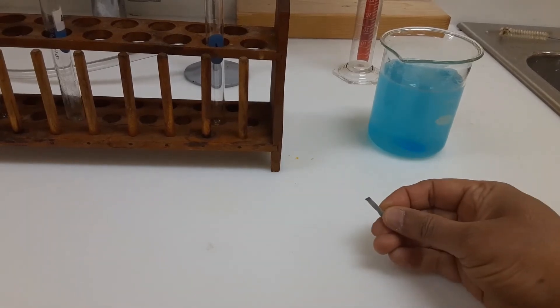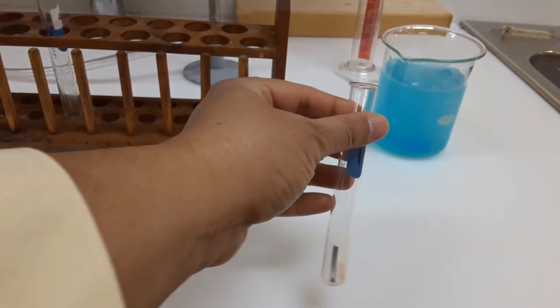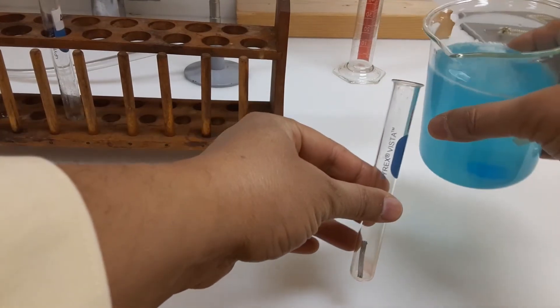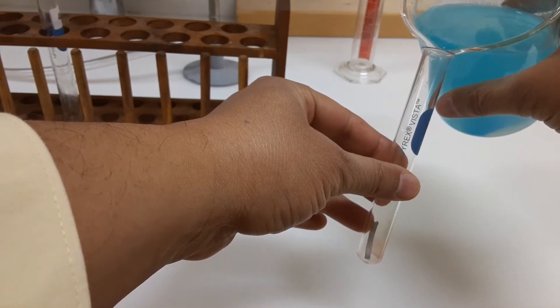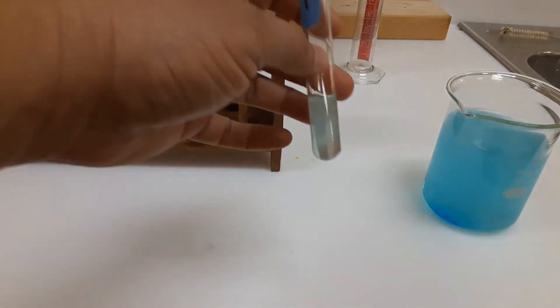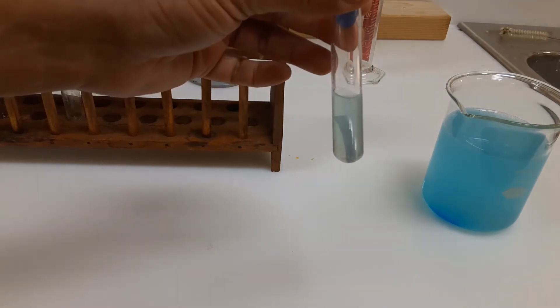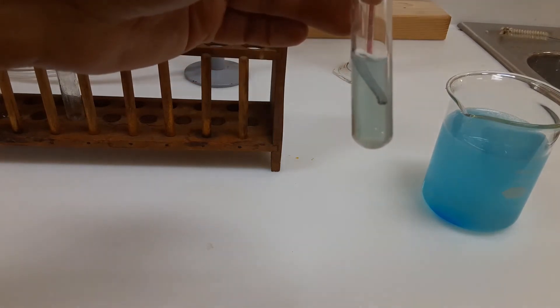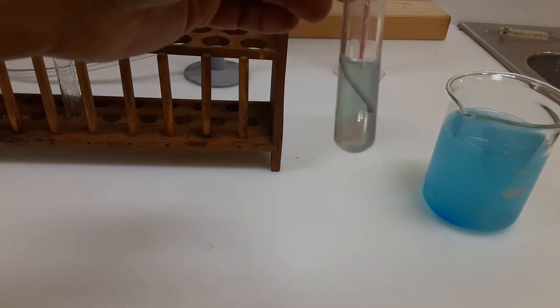We have a small piece of magnesium which we're going to put in a test tube. Then we're going to add a little bit of copper sulfate solution to it. The copper sulfate solution has covered the magnesium completely, and if you can see clearly into the test tube, you see that there are little bubbles attached to the magnesium, and those bubbles are gently rising to the top.